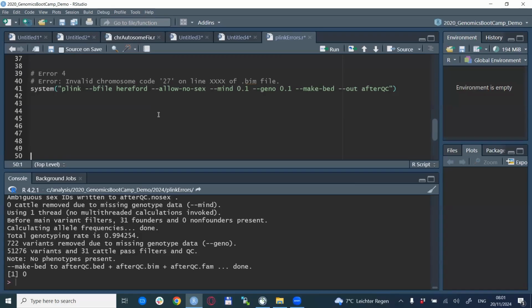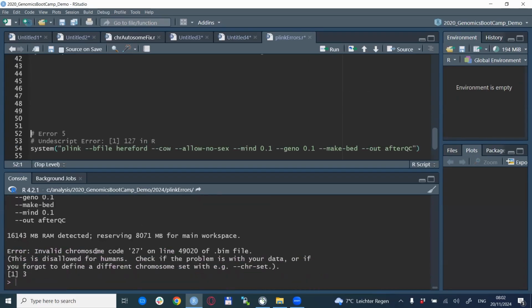So what's happening here? If you do not specify the number of chromosomes in one or the other way in PLINK, it will assume that you are working with human data. Now, cattle, for example, has 29 autosomes plus XY and the mitochondrial and so on. So if we do not specify either dash dash chromosome set or dash dash cow in this case, it would assume the human genome. And when you run this, then you get an error message, invalid chromosome code 27 on line.